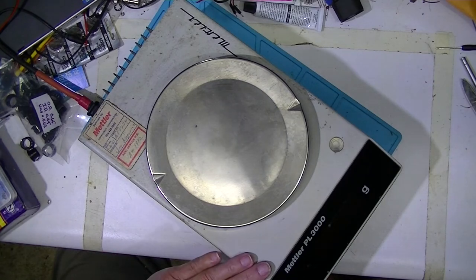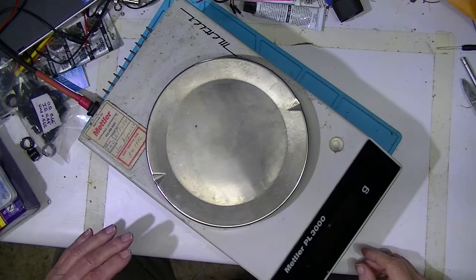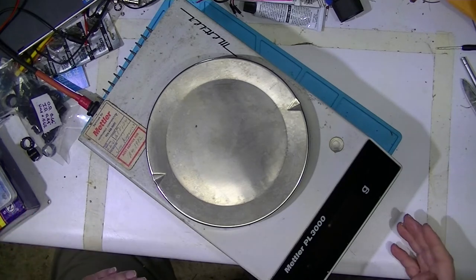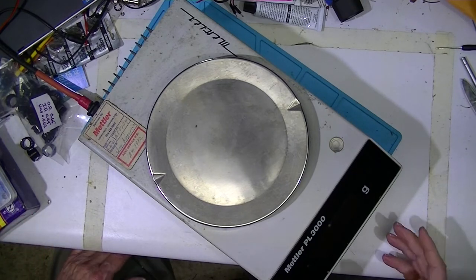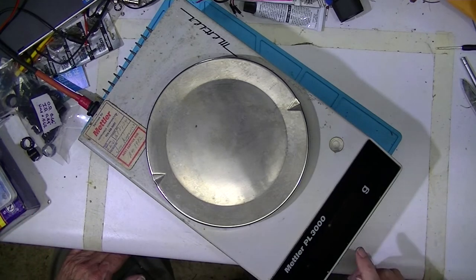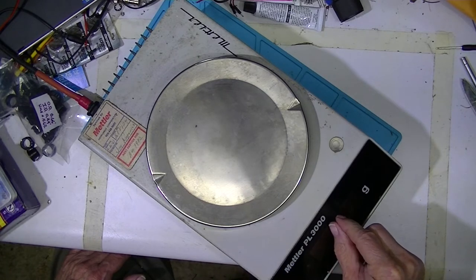What we have here is a Mettler electronic scale. I used this for a number of years, it worked fine, but when I bought it it was exhibiting exactly the same problem.